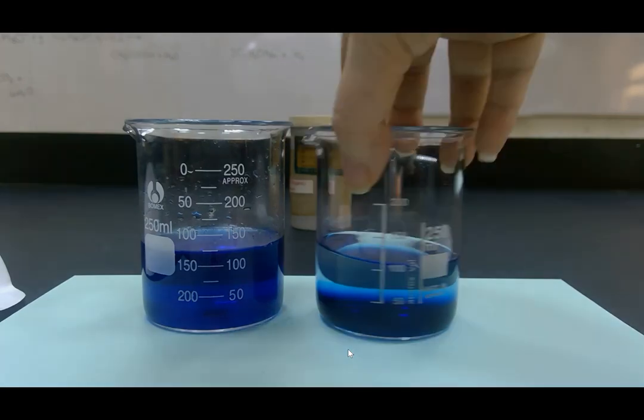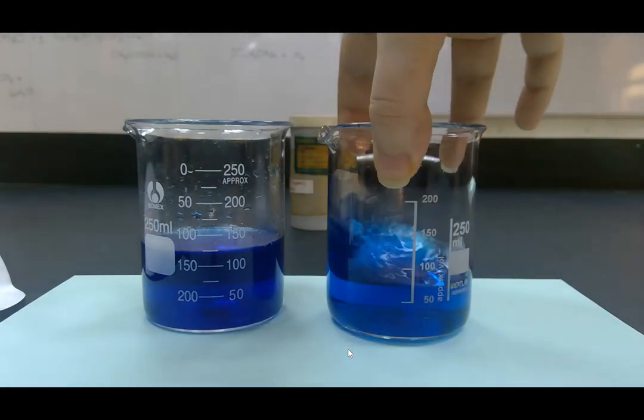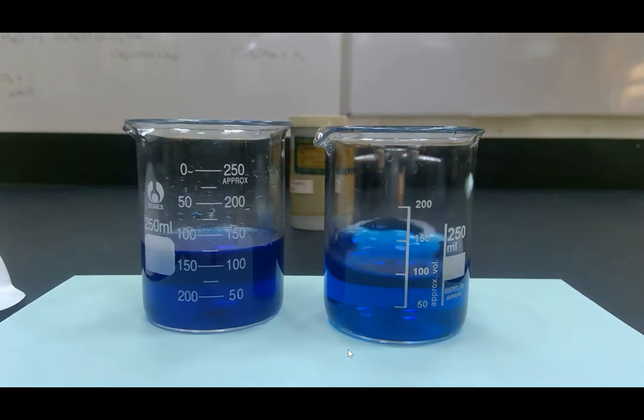However, you can tell the difference between them by observing the fact that one bubbles much more vigorously than the other when they react. You can see that bit of sodium is still going around and around in the alcohol. It still hasn't completely reacted. It's still bubbling away.